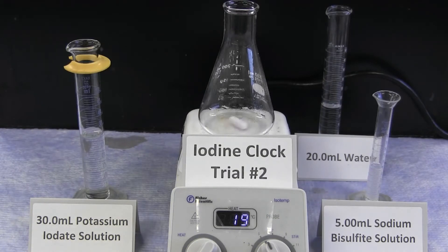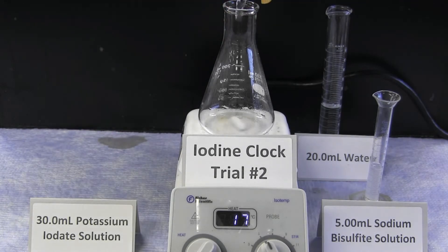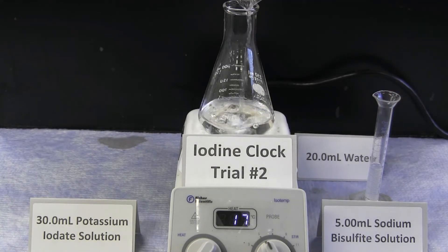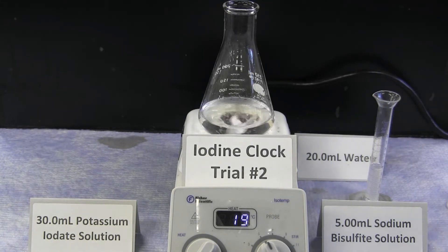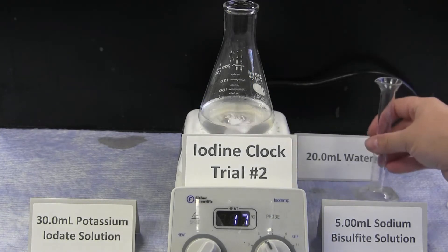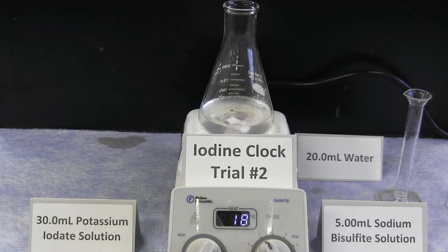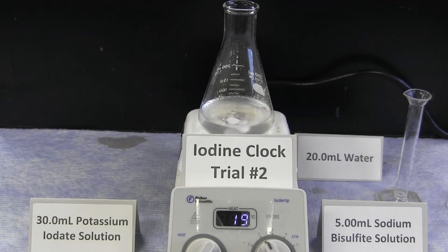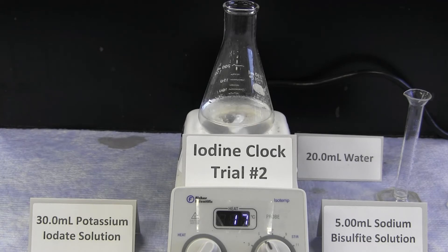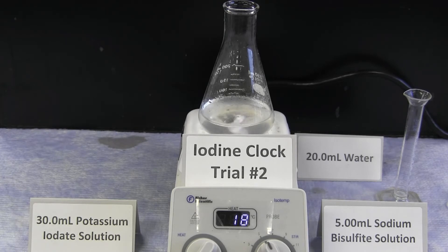The second trial is then performed using 30 milliliters of the potassium iodate solution, 20 milliliters of water, and 5 milliliters of the sodium bisulfite solution. In each trial, the final volume is 55 milliliters, ensuring that nothing is changing except for the concentration of the potassium iodate solution. By lowering the concentration, the reaction time is increasing.